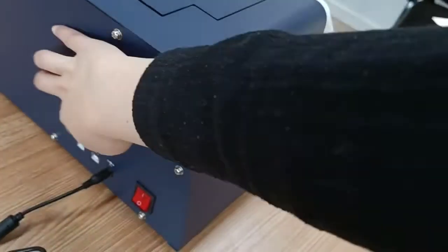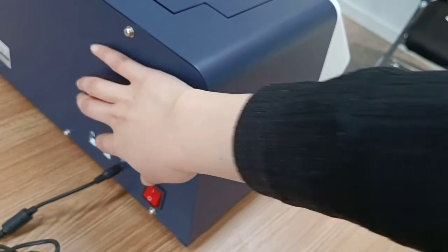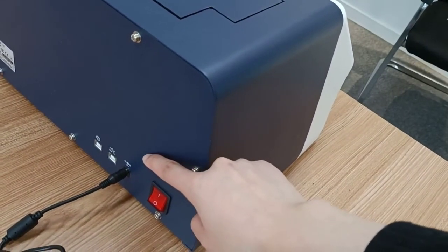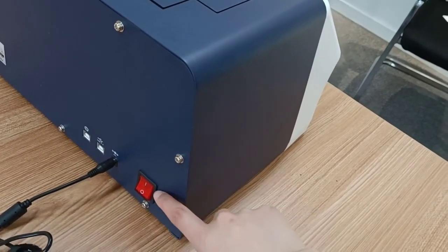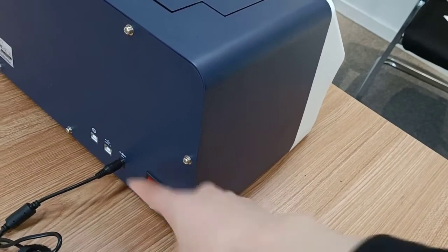Here are the print port, USB port, DC power port, and the power switch — push it to turn on.